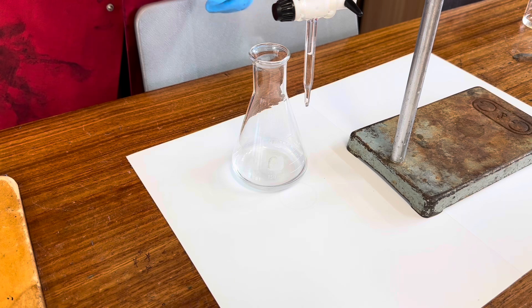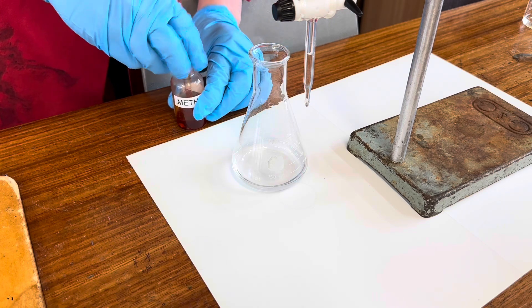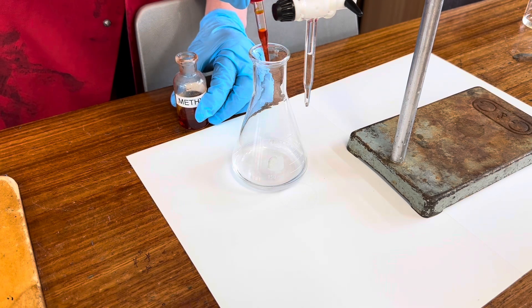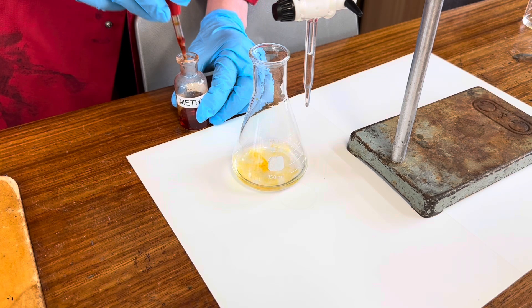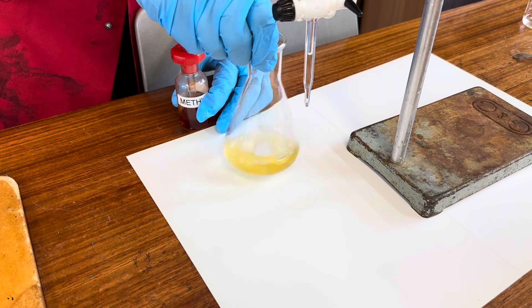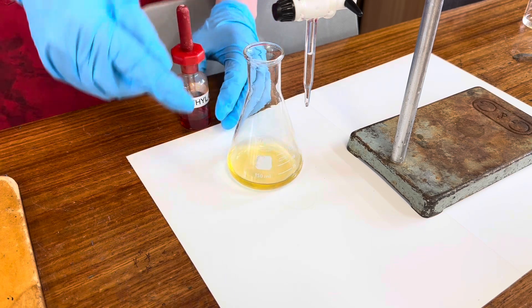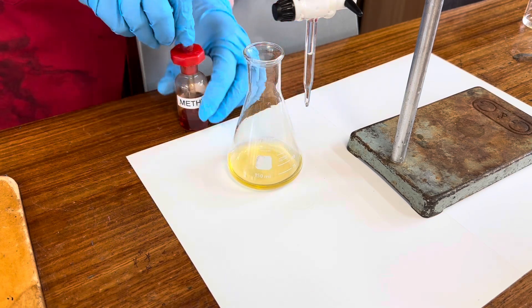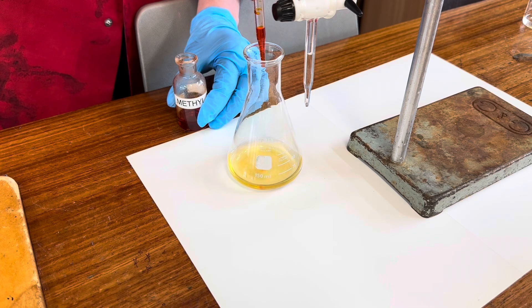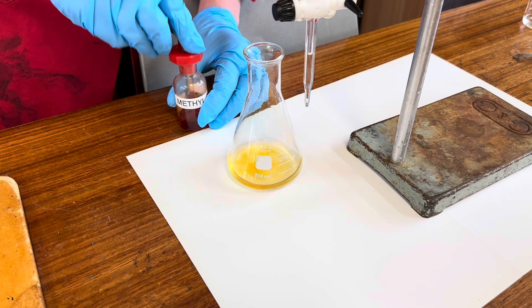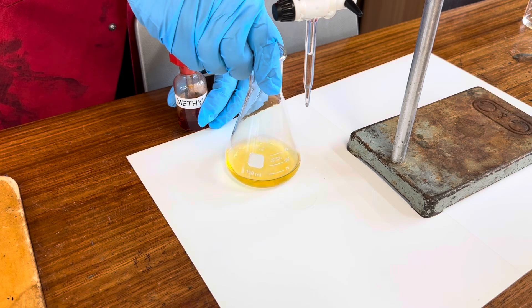And we're going to put a few drops of methyl orange in here. Because this is quite dilute, we'll add a few more drops. We've got to six, so that the color change is really visible.